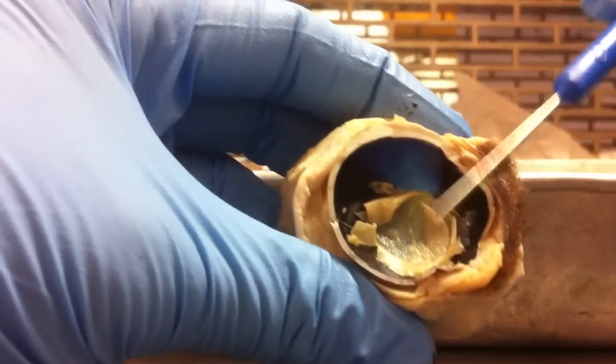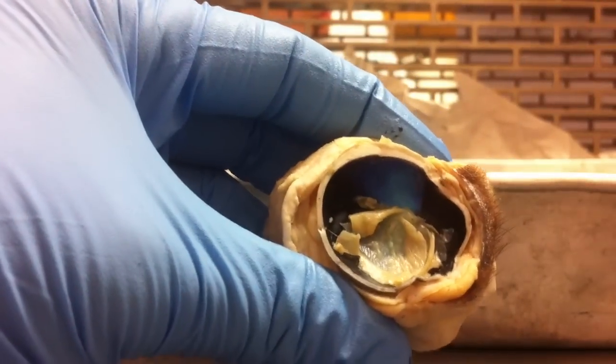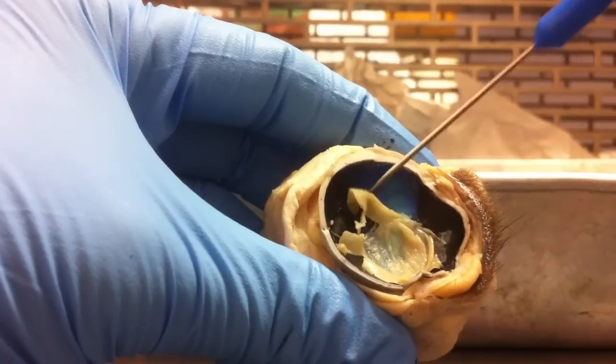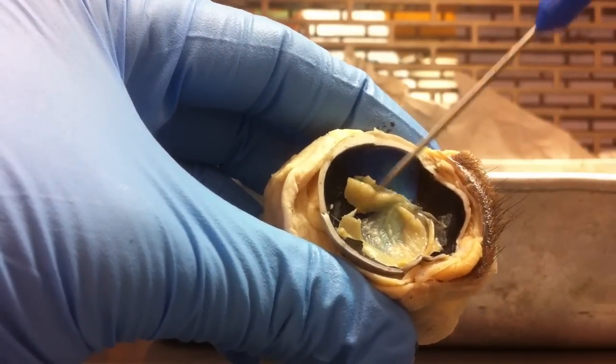This is your vitreous chamber that holds your vitreous humor. This tan material right here is your retina.